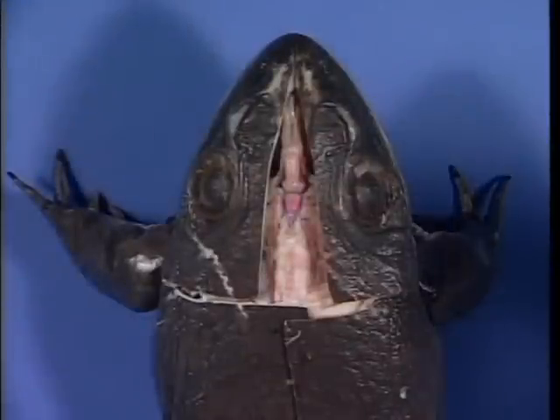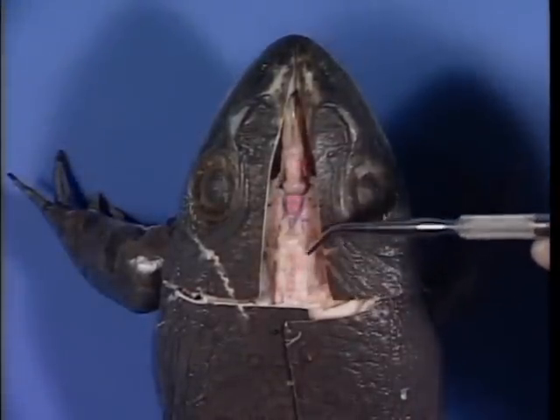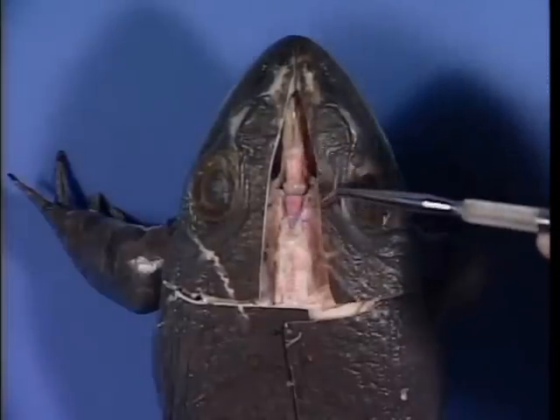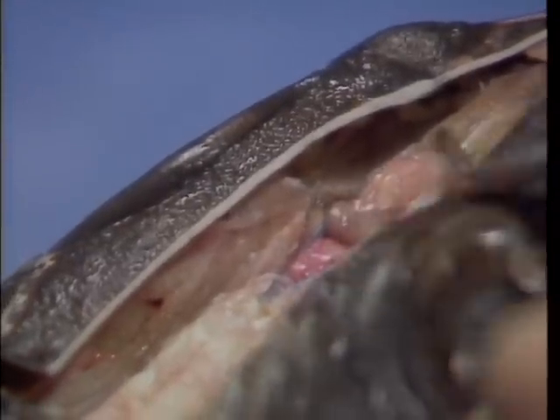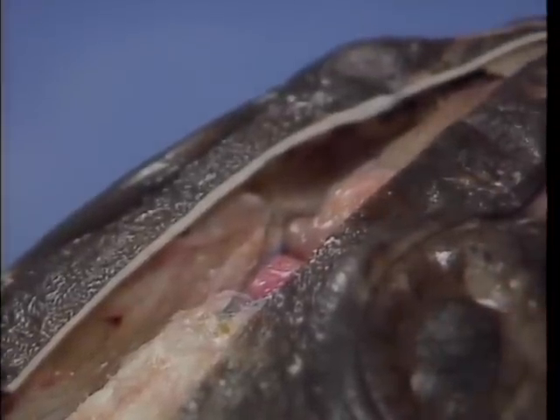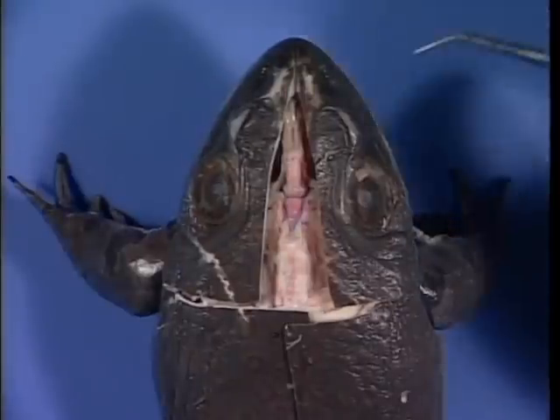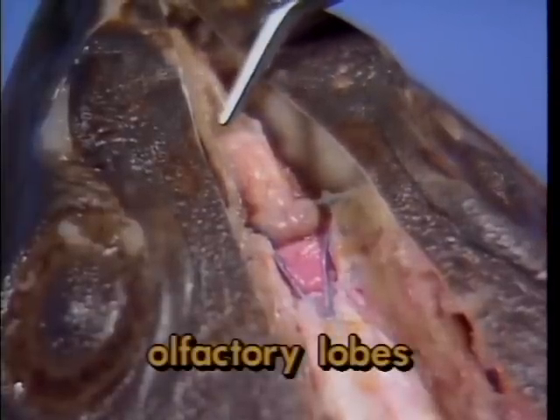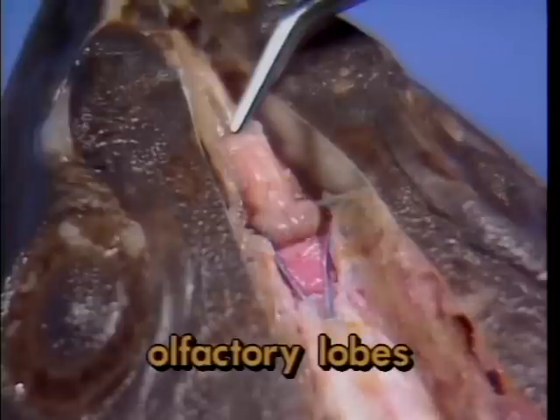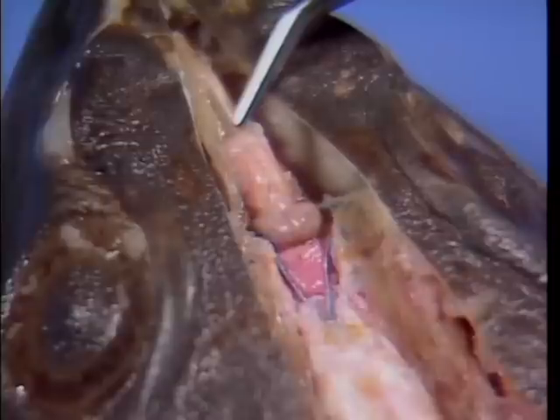In order to observe the brain, it is first necessary to remove all muscle and connective tissue from the median dorsal surface of the head. This will expose a series of bones running along the midline, which must be sliced away a little at a time. Once the bone is down to a thin layer, it is best to use scissors and forceps to chip out the last remaining bone. The small anterior-most pair of oval structures are the olfactory lobes. These receive sensory information coming in from receptor cells in the nose, which provide frogs with a sense of smell.